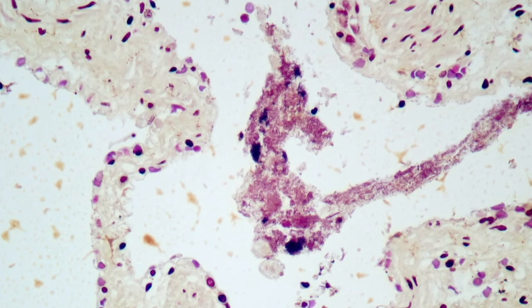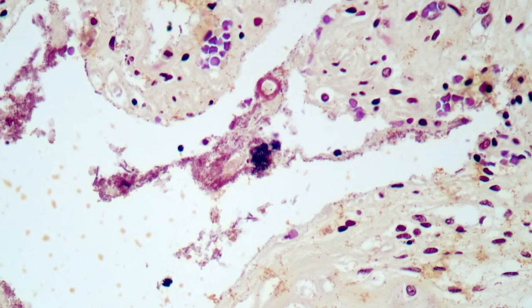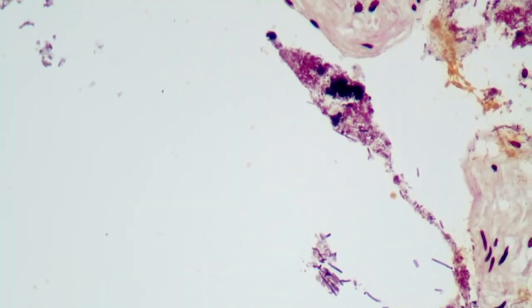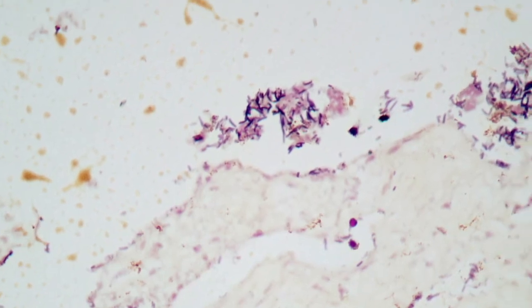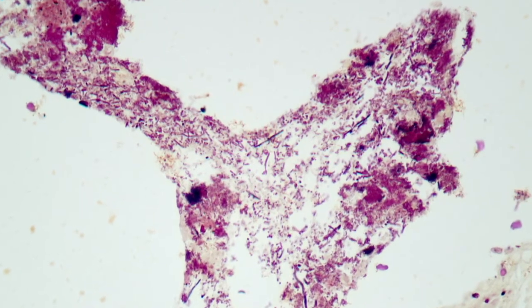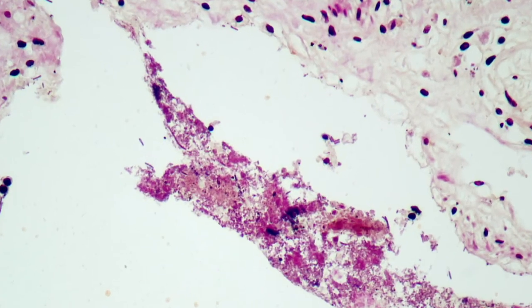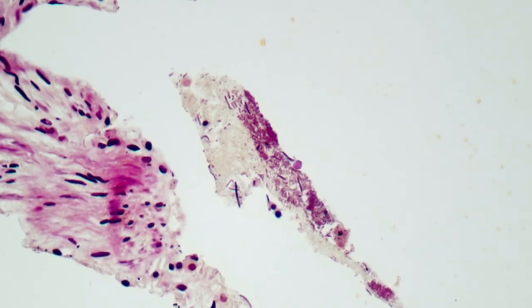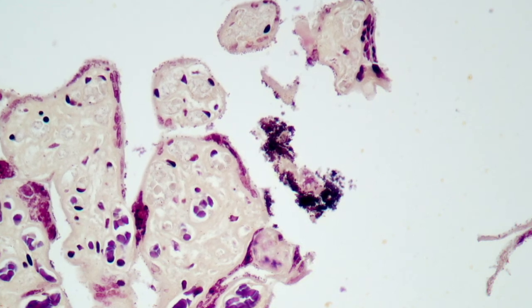Here are the outcomes of the staining achieved with the Brown-Hopps method. The yellow tartrazine gives quite a pleasant overall background, and the nuclei have retained some of the basic fuchsin. As we scan through these areas we'll come across mixtures of organisms — in this case some positive rods, and here a quite prominent rod in the middle. Here are some further dark blue positive organisms, as well as in other areas mixtures of positive and negative cocci. Here are some quite prominent positively stained cocci in that area.